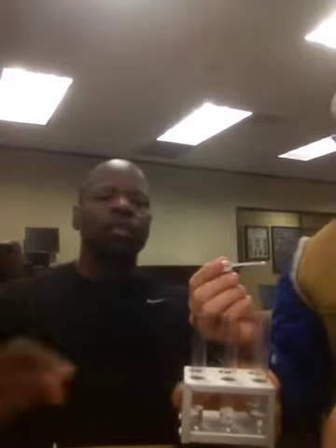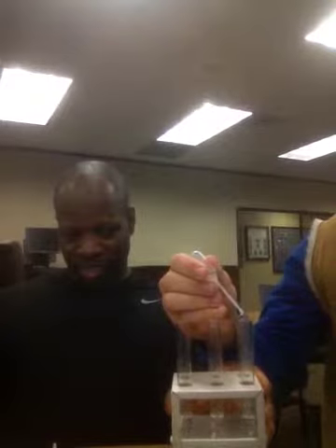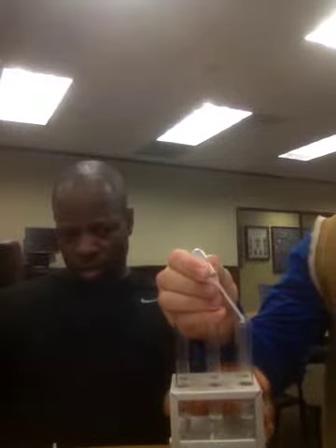So that's all our buffer solutions. We are then going to add 5 drops of the amylase to each test tube — one, two, three, four, five drops per tube. We'll shake these up to make sure they're well mixed.